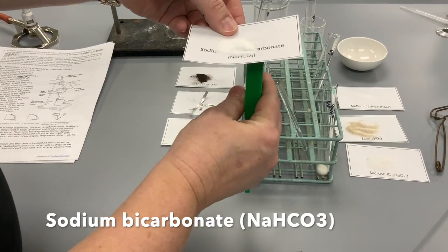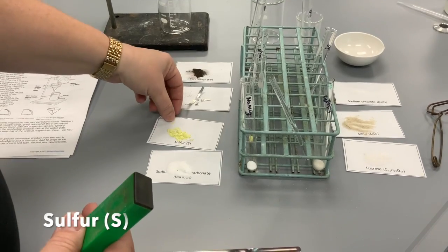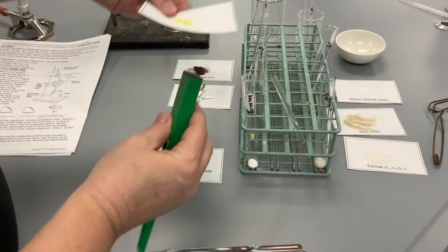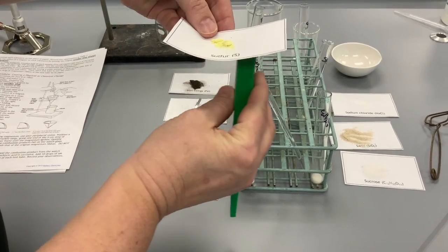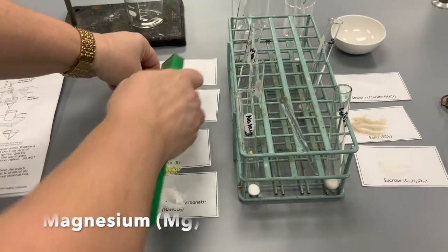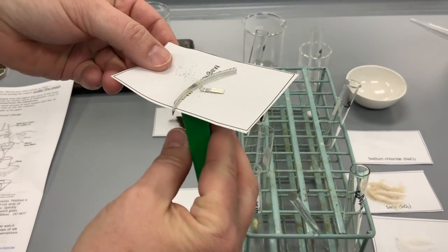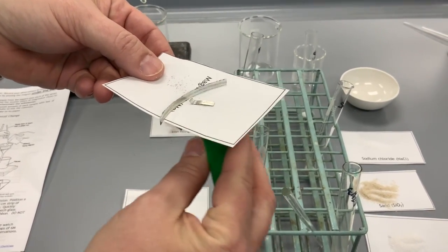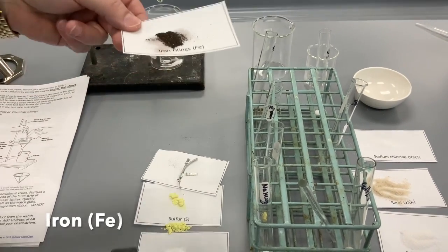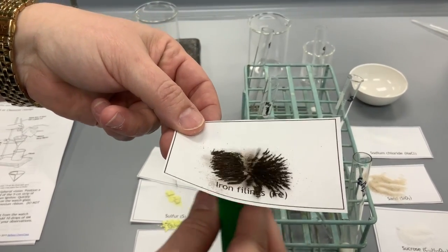So, not magnetic. Now I'll test the sulfur. Not magnetic. Let's try the magnesium. Not magnetic. This is the iron. It definitely is magnetic.